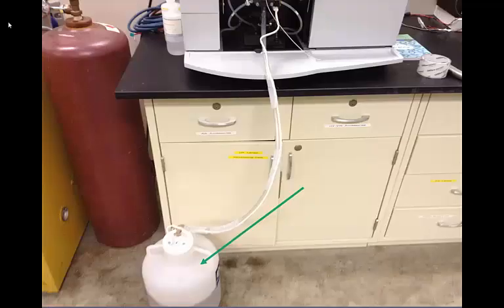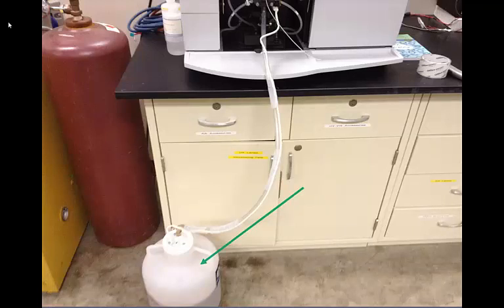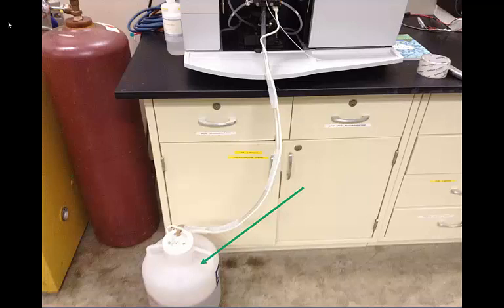Another very important safety consideration is to make sure that the waste container is not full and has sufficient volume to accept all the waste you will produce during your experiment. When in doubt, it's best to empty out the waste container. If it doesn't have sufficient volume, dump the waste into a heavy metal waste container in the laboratory, or another container as noted by your instructor.